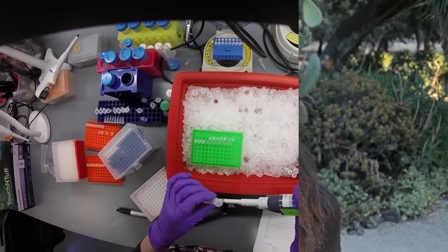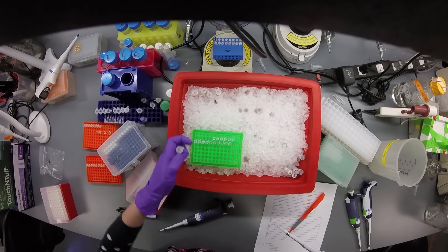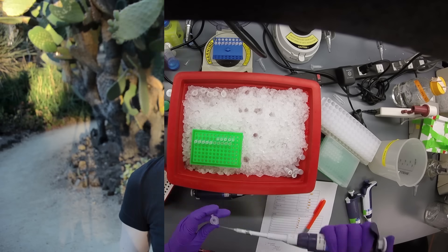I have DNA, I have primers, and I have polymerase — PCR time! After PCR, in each tube I have either short, nectarine-indicative chunks or long, peach-indicative chunks.